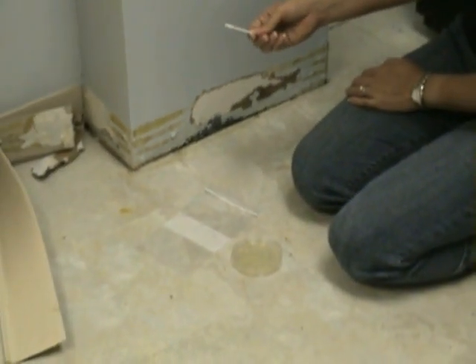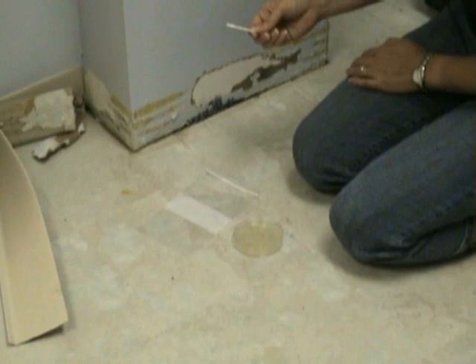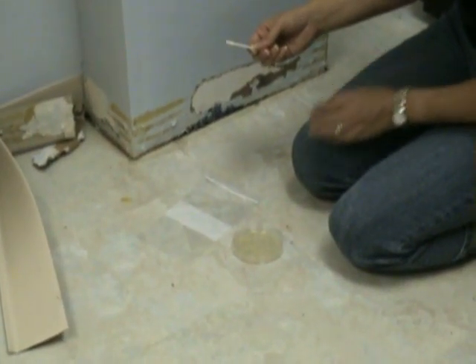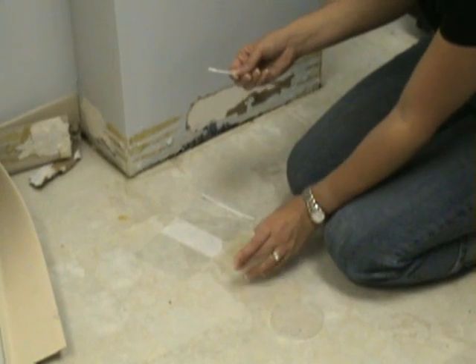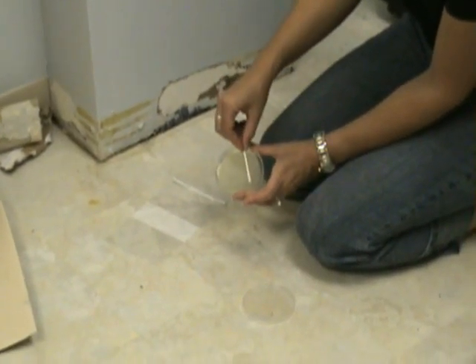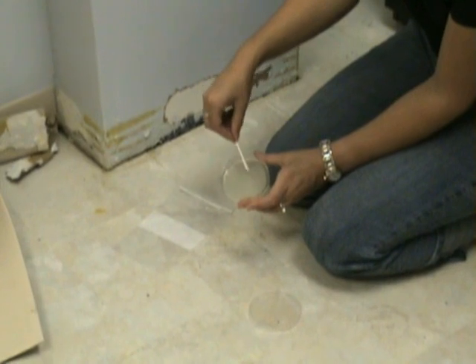Next, you need to transfer the substance from the swab to the surface of the gel in the test kit. Remove the lid of the kit and gently wipe the swab over the surface of the gel in the shape of the letter Z.